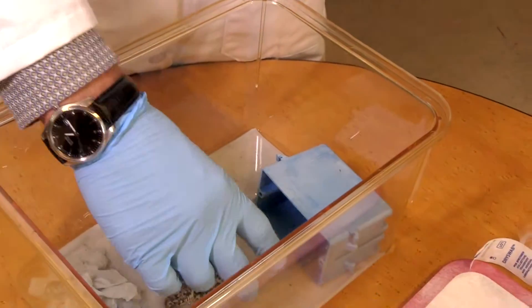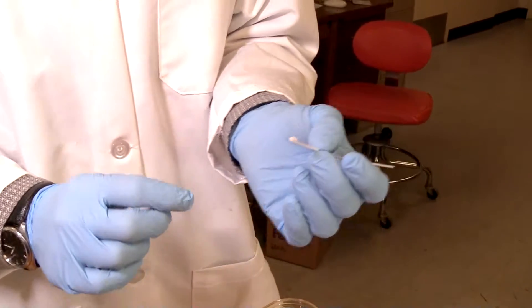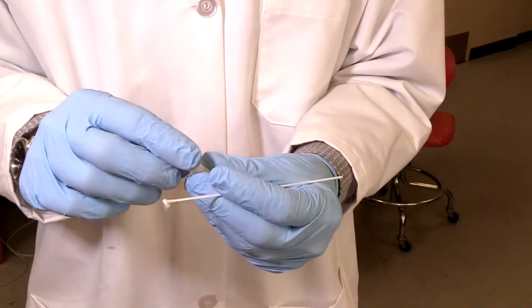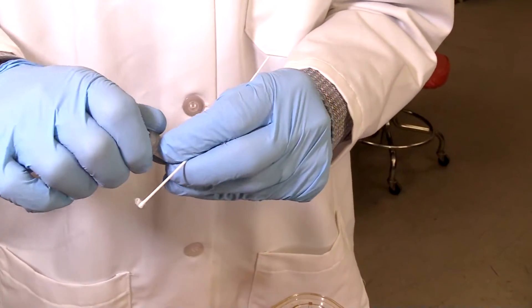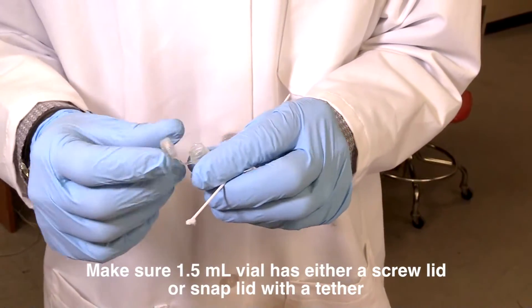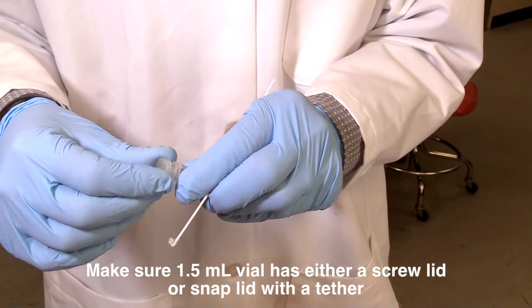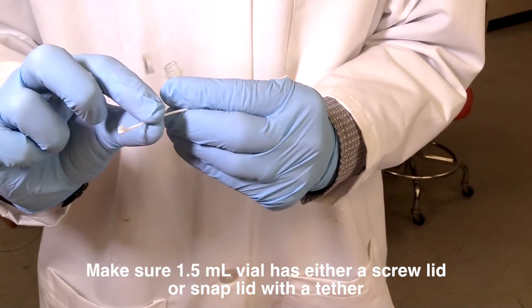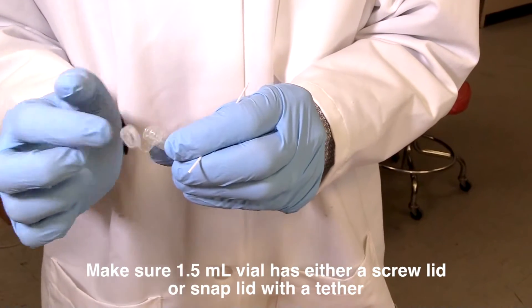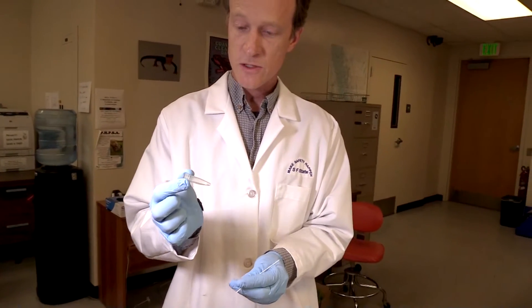So now he is perfectly fine. I'm going to set him back down in his cage. Now what I do is I get a little microcentrifuge tube, 1.5 mils — open it up. You want to get the kind that when you heat it up, it doesn't pop open, so you want either a snap lid with a hook or a twisting lid like this one. I break it off, put it inside, put the lid on, and now I am finished. There is my chytrid swab. We will then extract DNA from this for the qPCR assay.